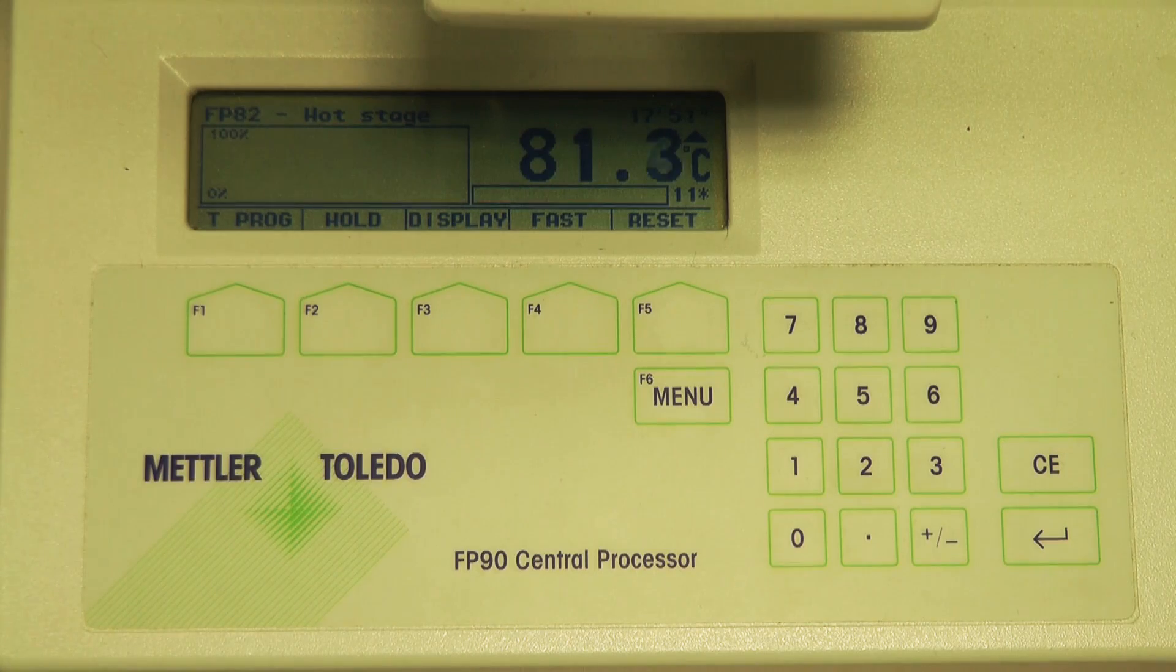When the experiment is finished, the program will stop recording and the hot stage will begin to cool. Do not touch the hot stage until it is cooled to at least 40 degrees.